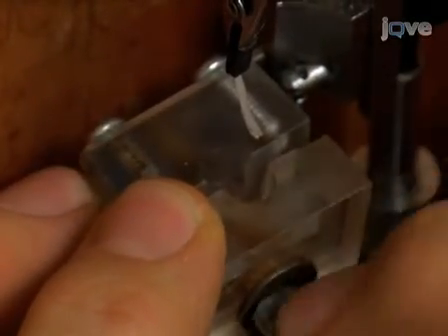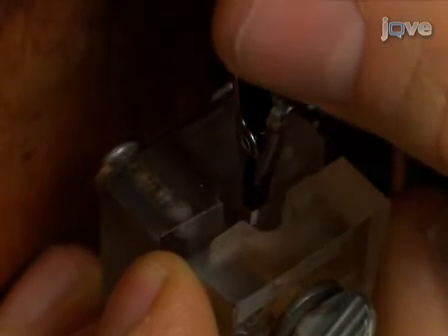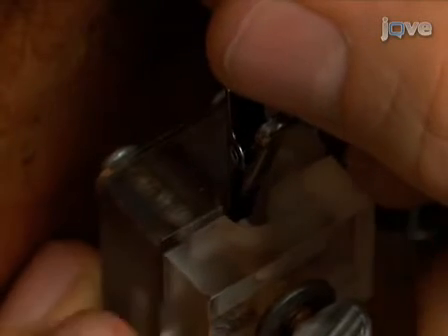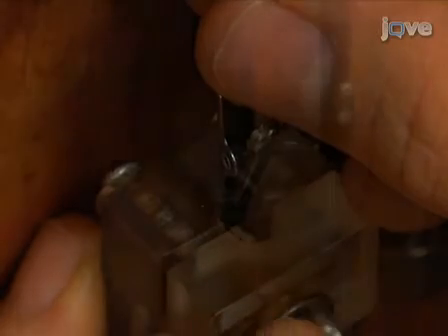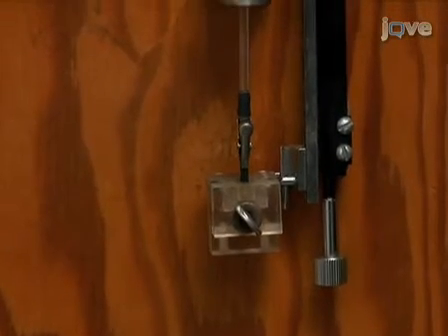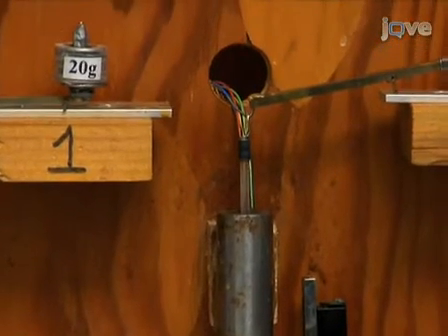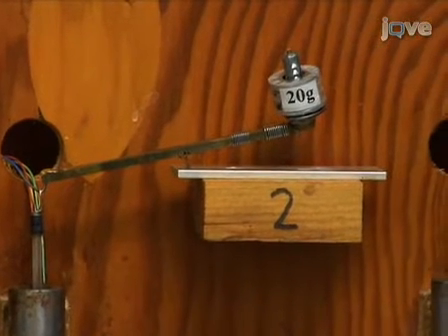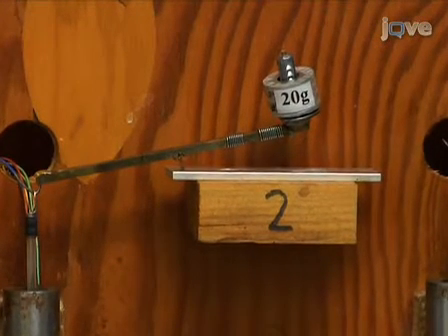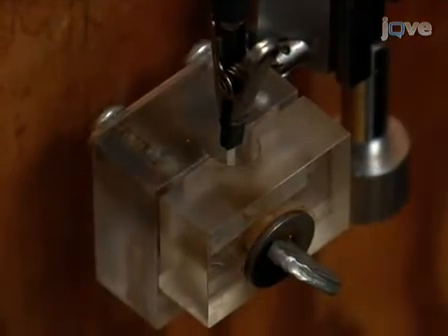Holding the movable clamp assembly in one hand, the basal end of the wall specimen is now maneuvered in between the two hinge pieces of the plexiglass cuvette, and the cuvette pieces are brought together and screwed tight, thereby locking the bottom end of the wall sample in the cuvette. The movable clamp assembly is now gently released, allowing the full force of the counterweights to be transferred to the wall specimen. We routinely use a total counterweight of 20 grams for wall samples prepared from cucumber hypocotyls. Other wall materials or experiments might require different weights.